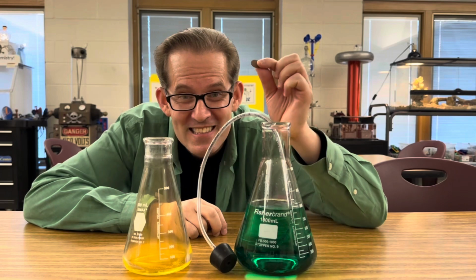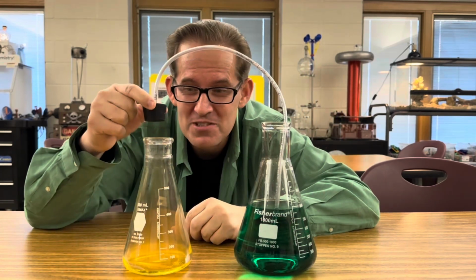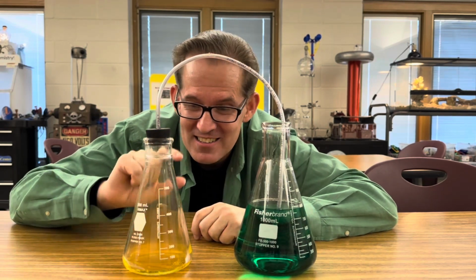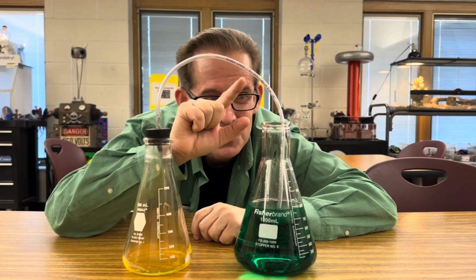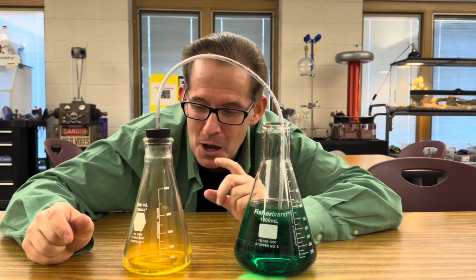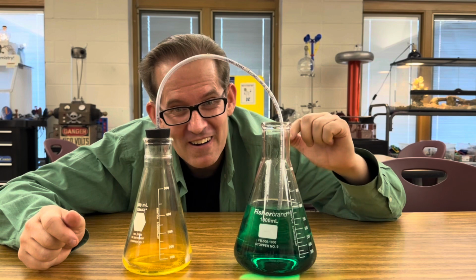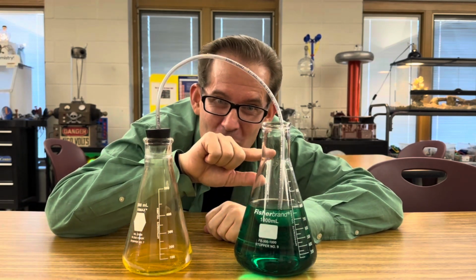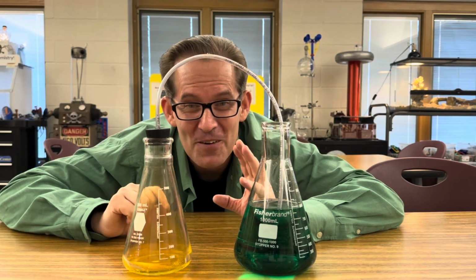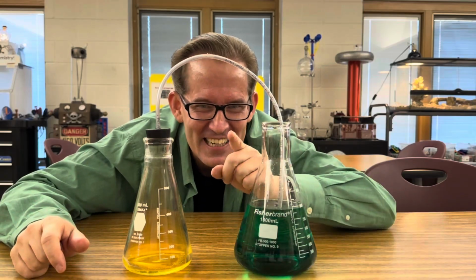Okay, the next step is to add the penny to the 16 molar nitric acid. We'll fasten the rubber stopper on, and slowly it'll release nitrogen dioxide that will travel up into the tube, and when it reaches the water, it'll start to dissolve in the water, and that will reduce the pressure in this flask, while the atmospheric pressure on the water in this flask will cause the water to rise back into the tube and travel back into the beaker with the nitric acid, creating a nitrogen dioxide fountain. Check it out.